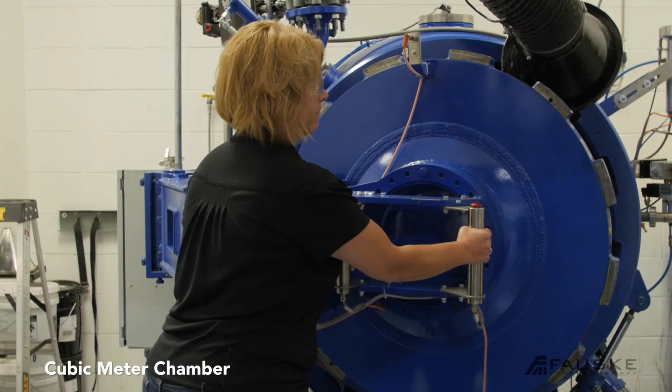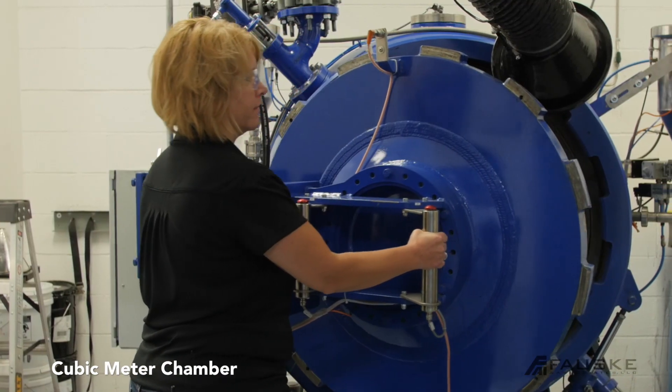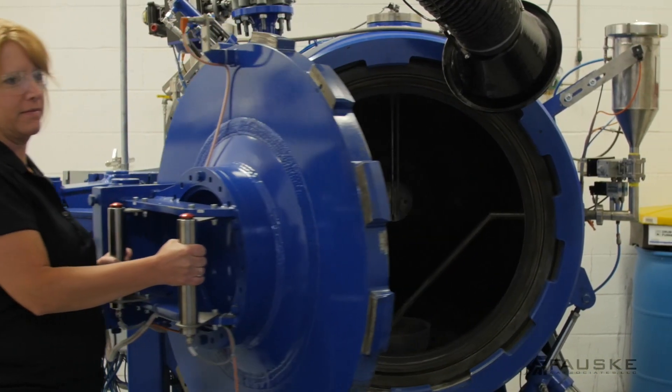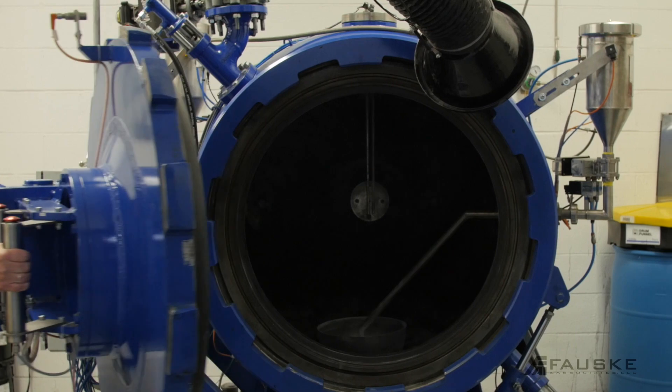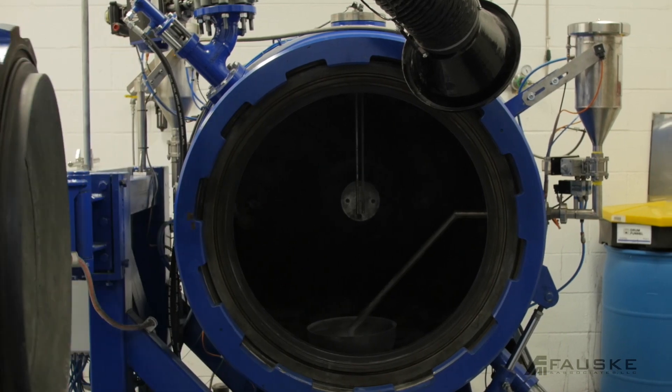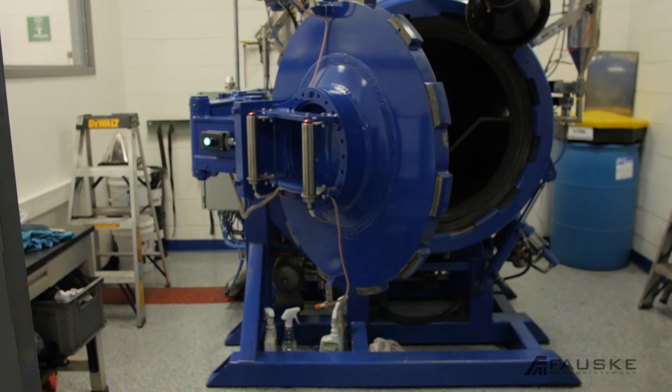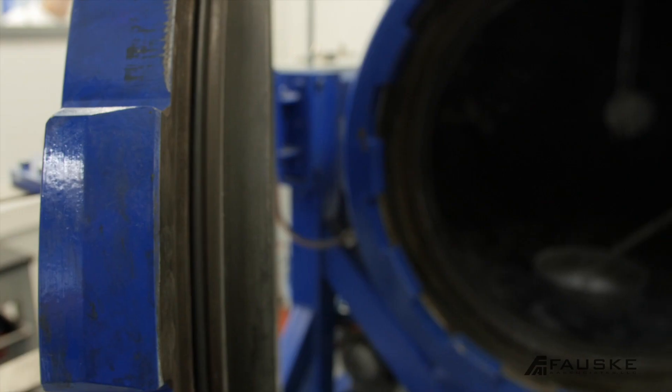This is our cubic meter chamber, one of only a few in the United States. The cubic meter chamber is used to verify the results found in the smaller 20 liter test vessel.